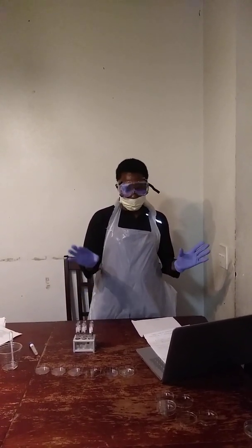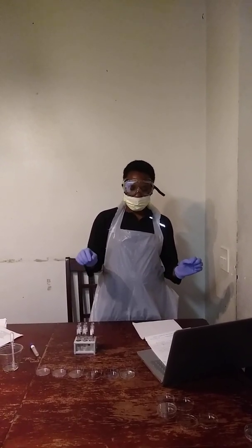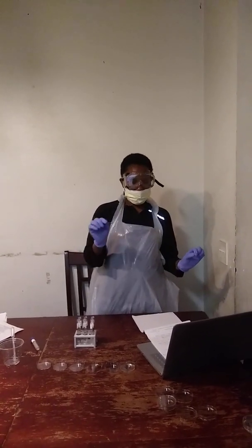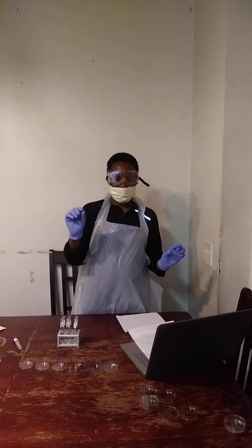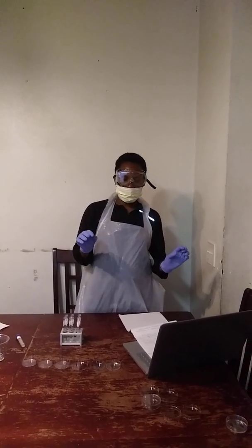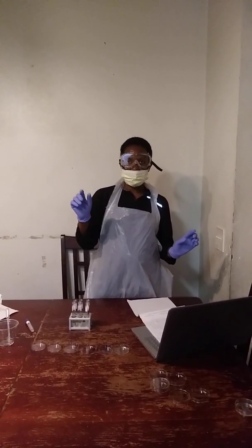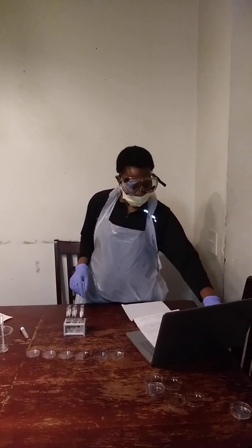In other words, for every test tube it's gonna be 0.5, that is the volume added, out of 5 ml, which is 1/10. And so to get the count, if it's 0.5 to 5 ml, which is the same as 1/10, and which is the same as 1 times 10 to the power -1, or the ratio 1:10 dilution.